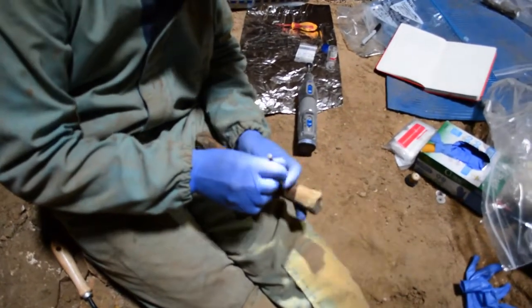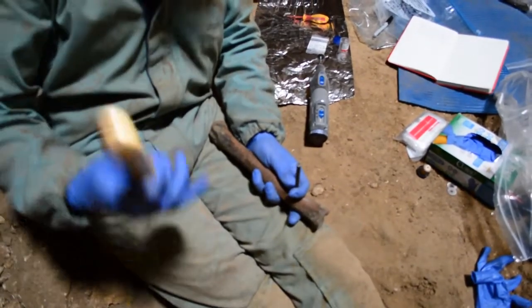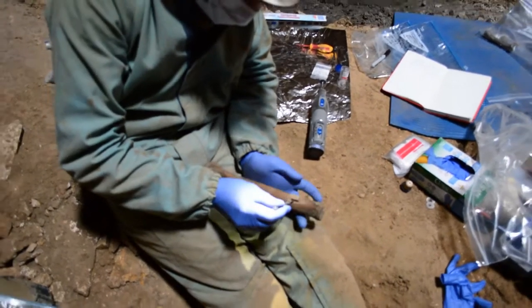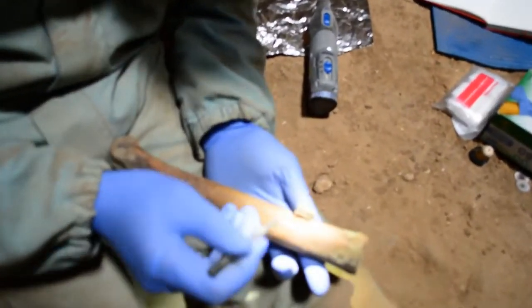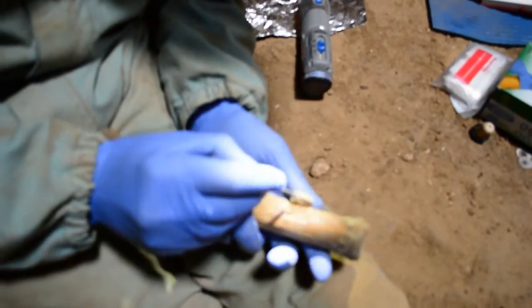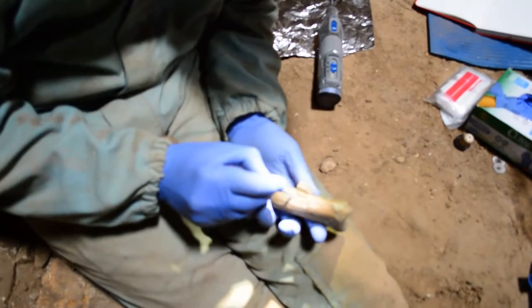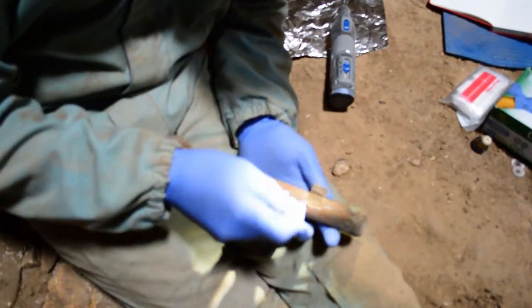You can see I've cut four holes. I originally learned how to do this by watching the 'Unbearable Likeness of Being,' and then I have a high-tech hammer here. I'm going to try to knock this open — and as you can see, there's the inside. The color is not fantastic but it's not too bad — you can see this lighter brown cross-section, and there's the marrow cavity, which obviously isn't full of marrow now.